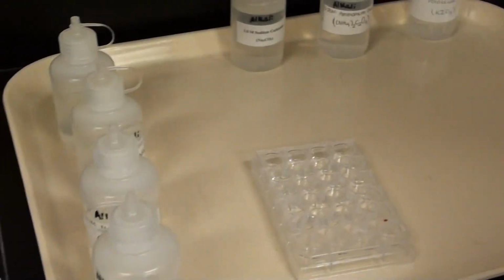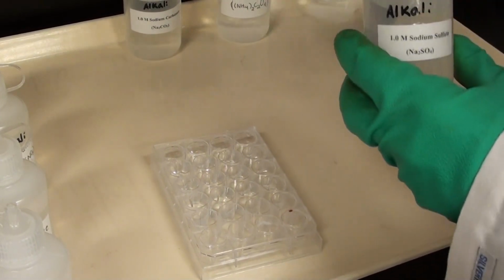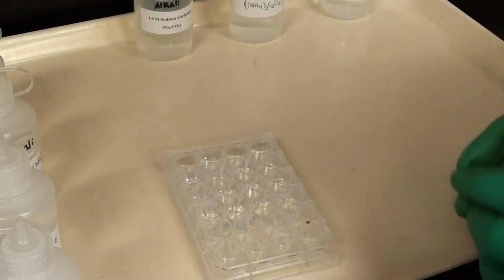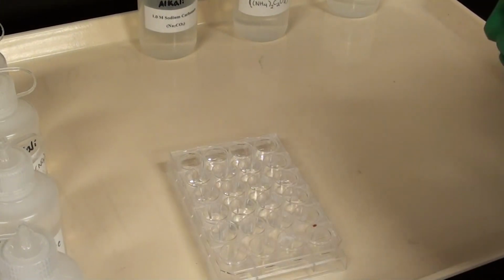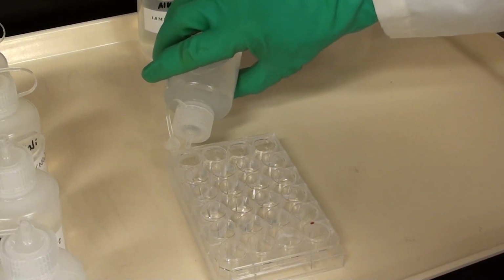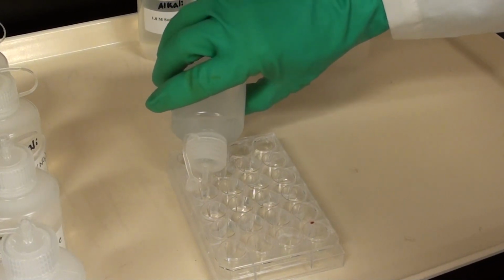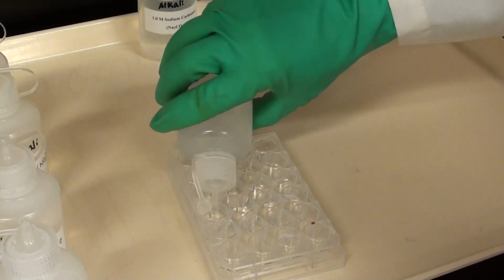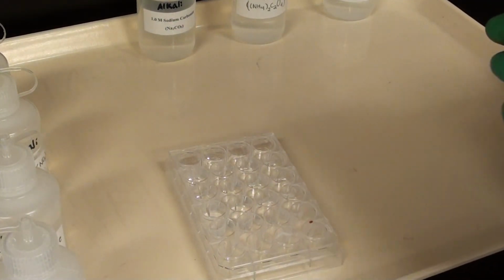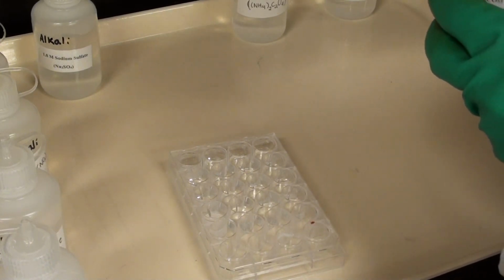Now Jim's going to add in his first sample of anion. That's going to go down the first column, including the unknown, if the unknown was added. That's right. So he's going to go ahead and do that. I'm only going to add a couple drops to this. Just a couple of drops? Okay, that's good. That should be sufficient to get the precipitate, if there is going to be a precipitate. So he's going to go ahead and do that for all of these samples now.